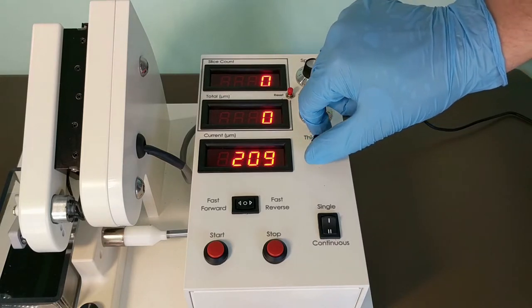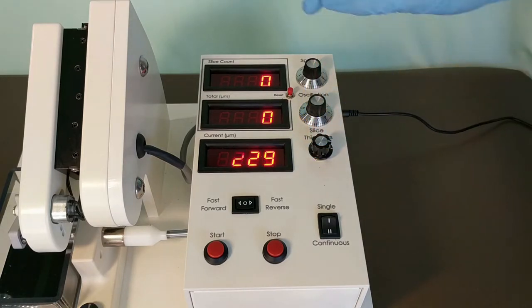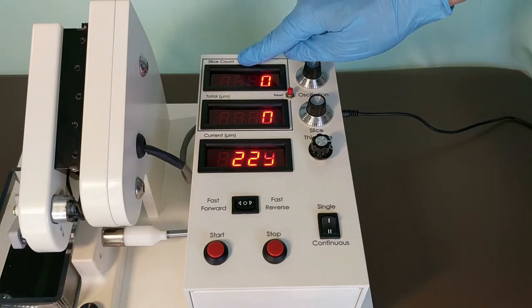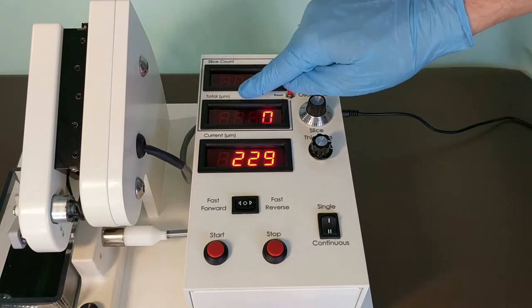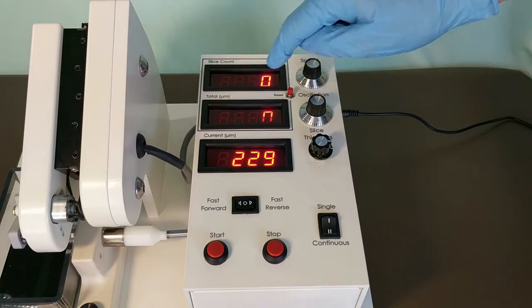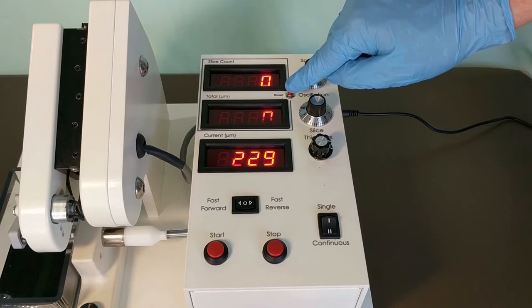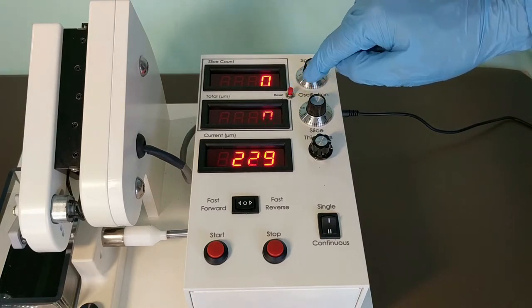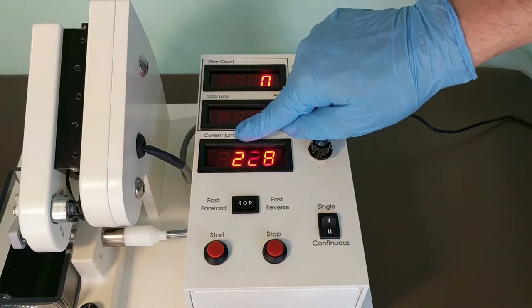The control box keeps track of your slice count and total thickness, along with the reset button. It also displays the current thickness setting.